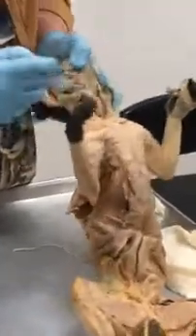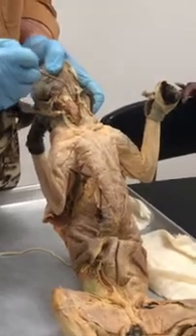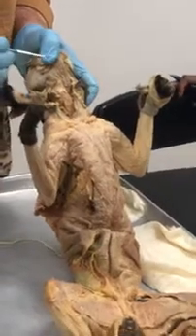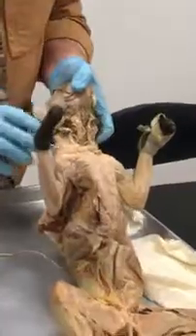Then we have another one that goes from the hyoid, but it goes up, in this area up here. What is that? Mylohyoid. Good. So there are your 2 muscles that you need to know, at least for my class.